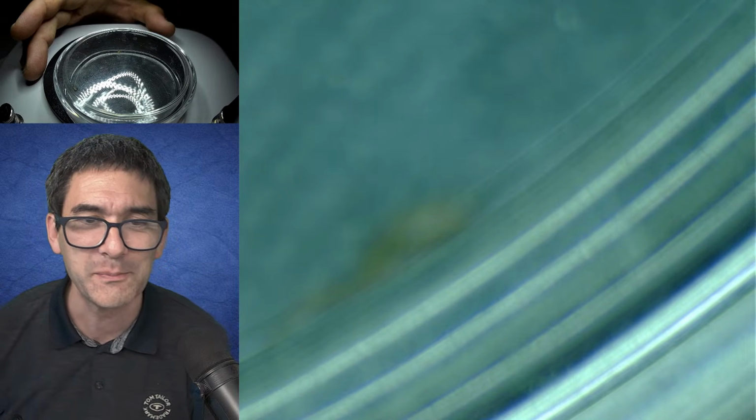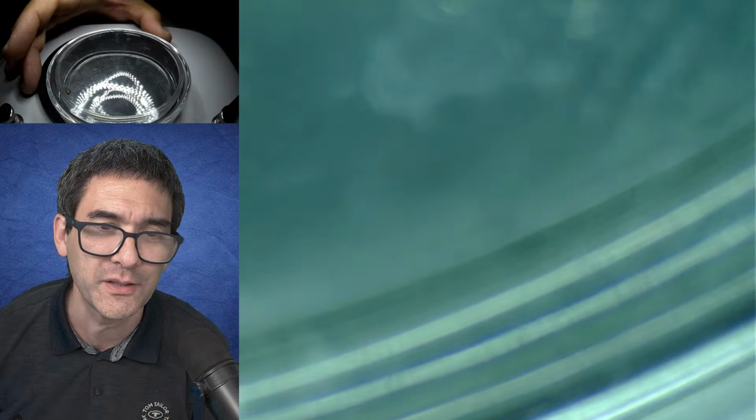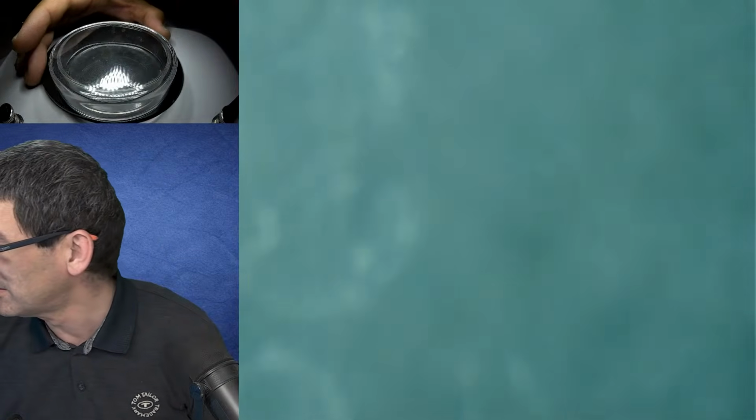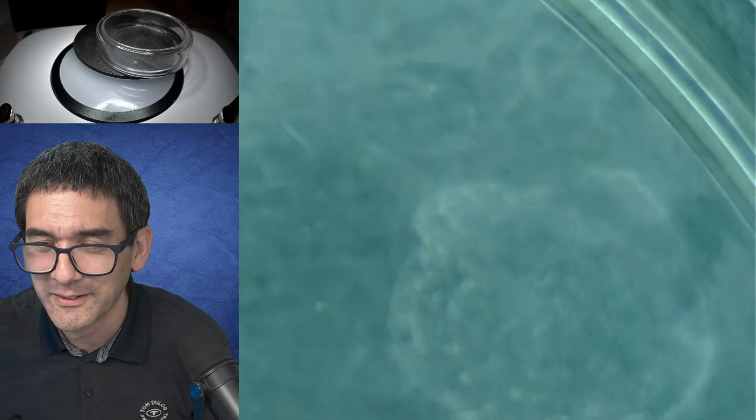I don't like spiders particularly, obviously, but when you put spiders under the stereo microscope, they look less scary than some of the insects. Some of the insects with their, I don't know, mandibles and big antennae and so on look actually more like aliens, and scary. Spiders actually look less scary when you magnify them, I think.